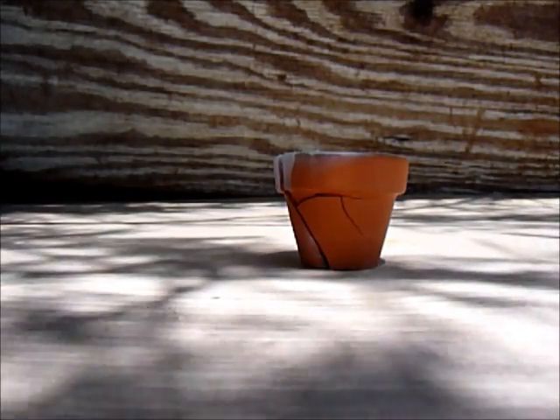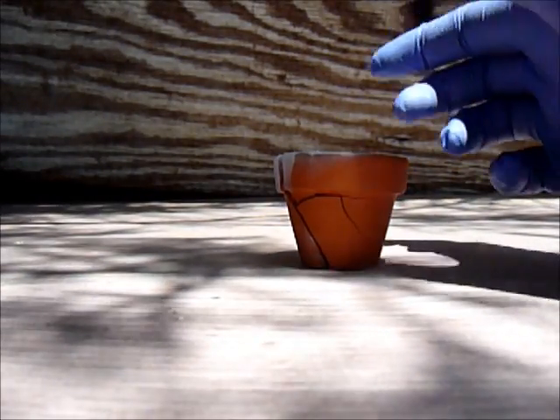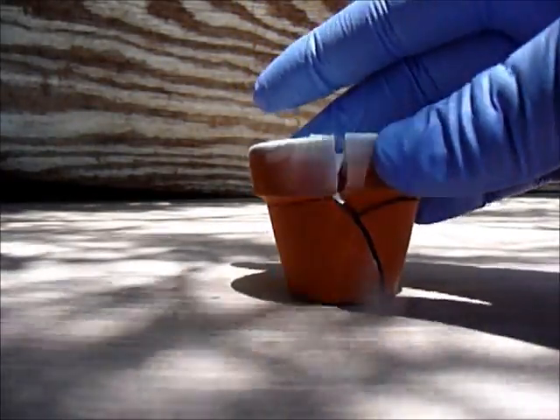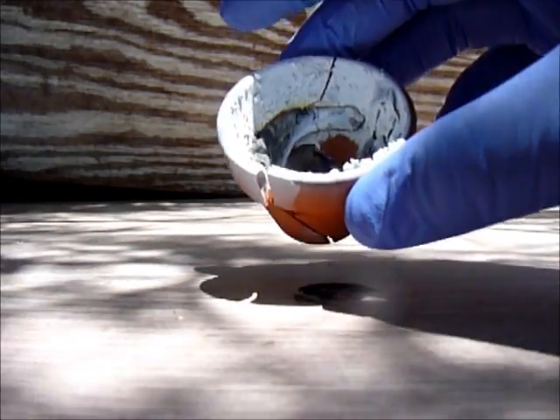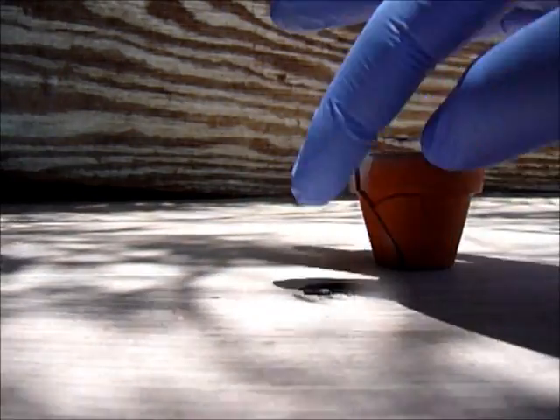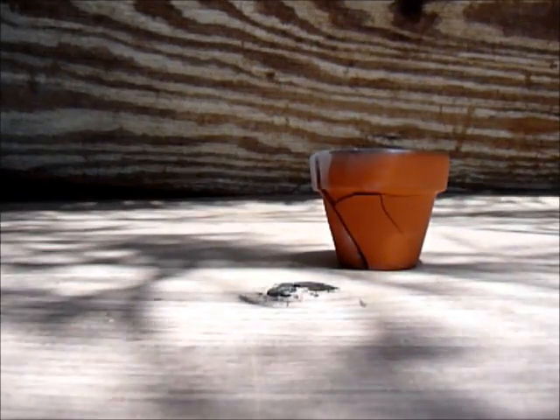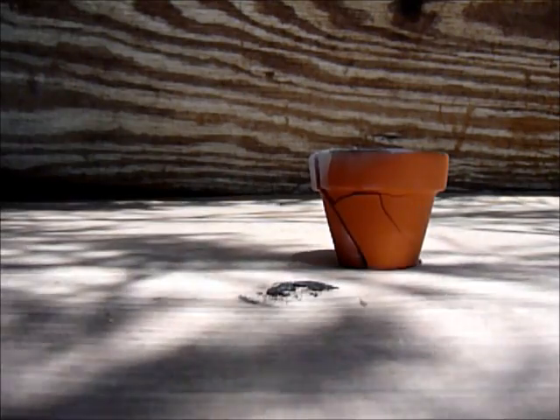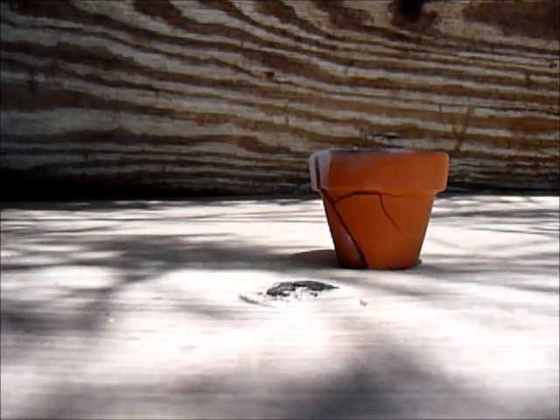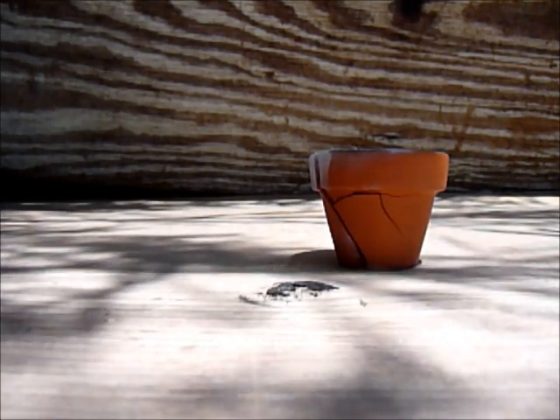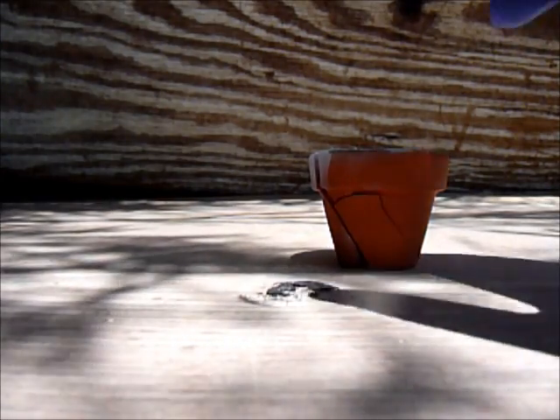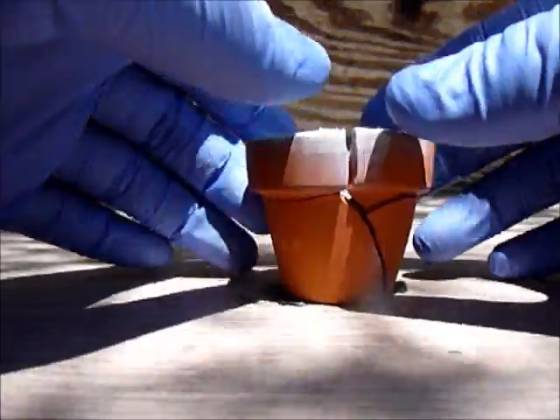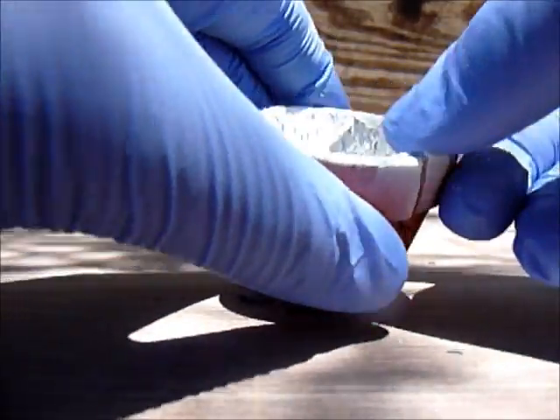It's been about one hour and my little vessel or pot is broken. I'm doing this outside because if I do it inside, my whole room will smell like rotten eggs because that's hydrogen sulfide. Right now in Southern California, it's about 105 degrees.